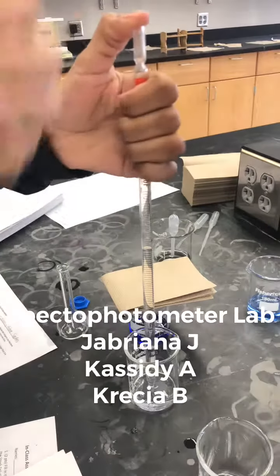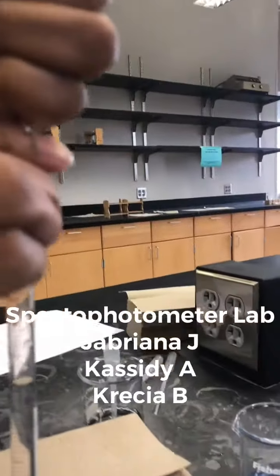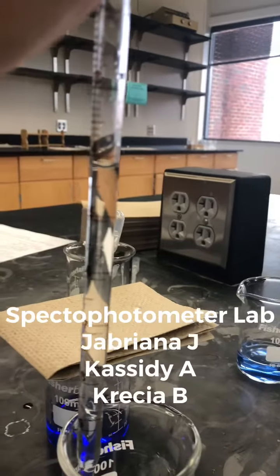This week in lab, we worked with the spectrophotometer. And before we had to work with the spectrophotometer, we had to get dilutions. And this is us taking the dilutions.